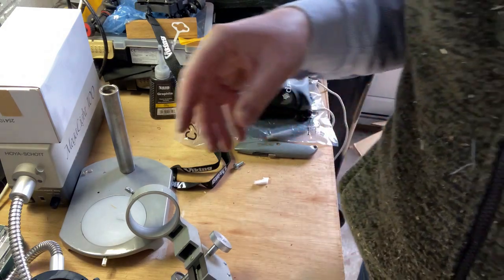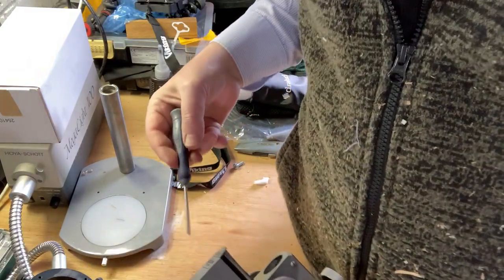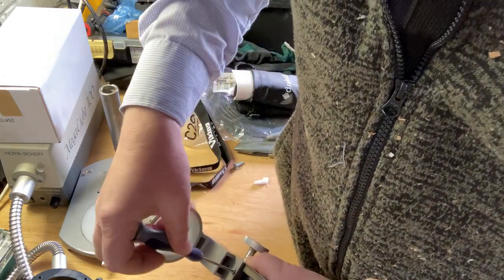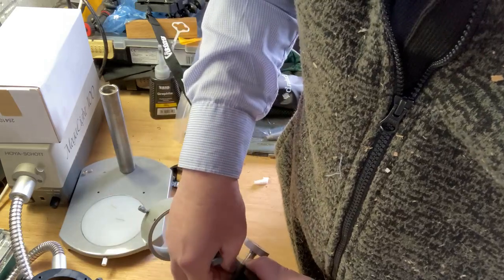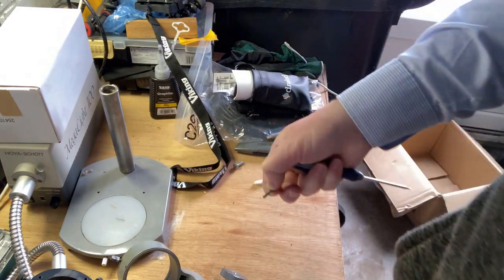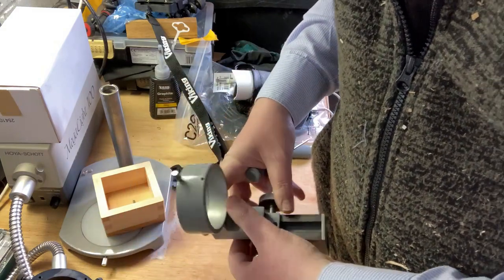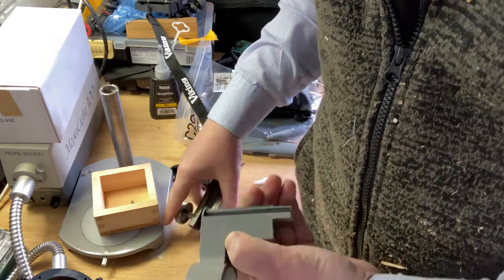And let me just pause it while I go. Okay, so let's just take that screw first. I'll use my little sake cup, and then that should hopefully come out there. Okay.